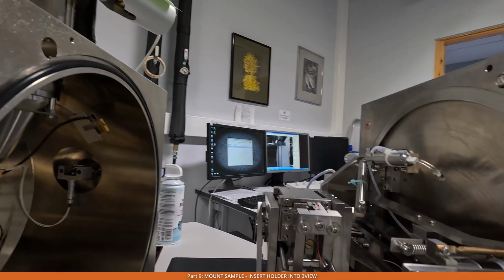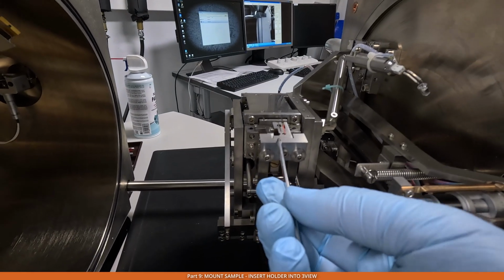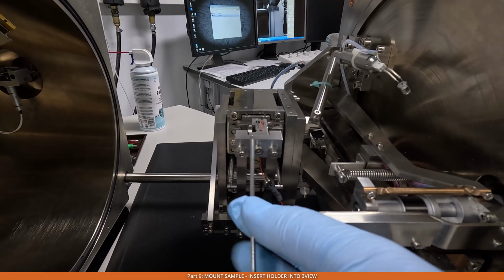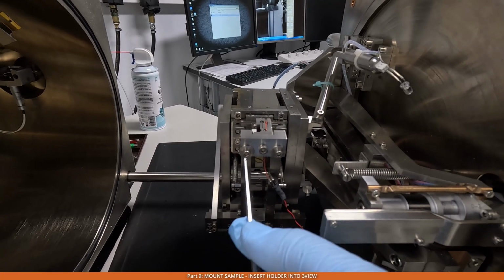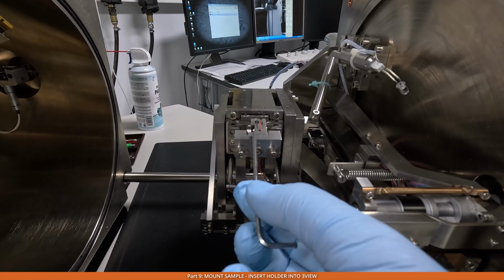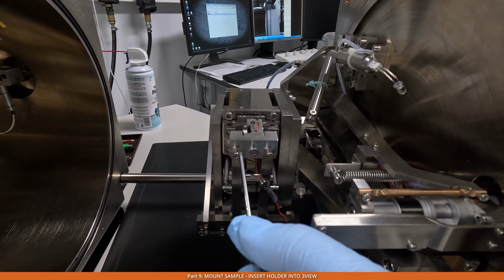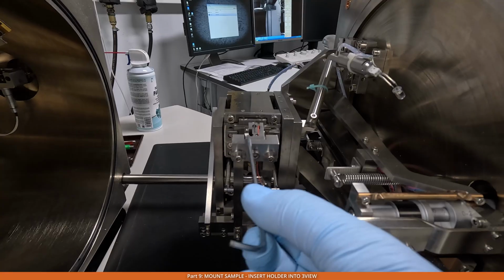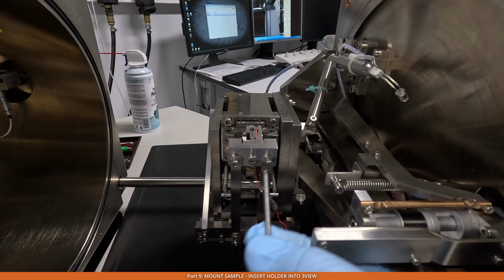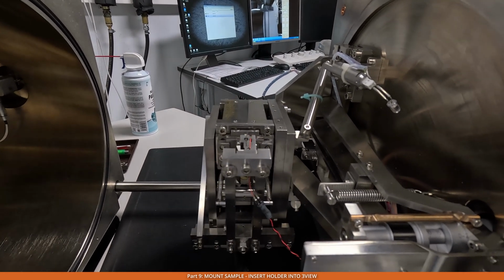While we have it open, let's take a look a little bit at a few other things. This is the knife, and the two screws here are used to hold the knife. The idea is that by loosening these screws, you can move the knife left and right and put it aligned to your sample as much as needed. To tighten this, you press from the top over the knife and gently tighten this screw and after that the other screw, so that the knife assembly is staying in place.